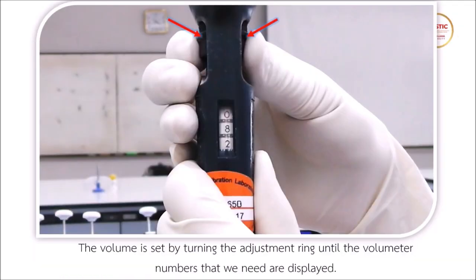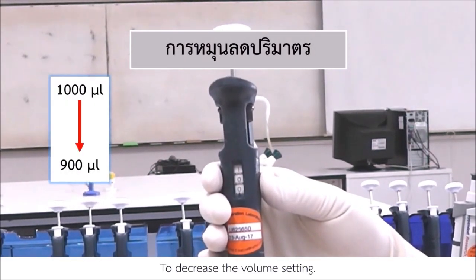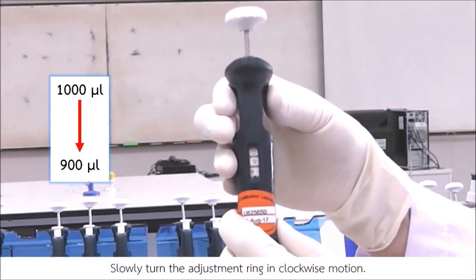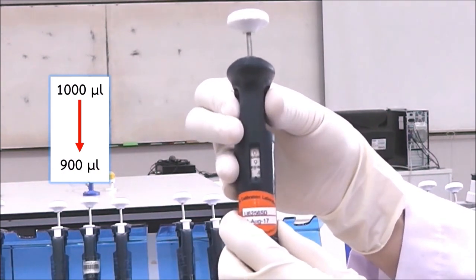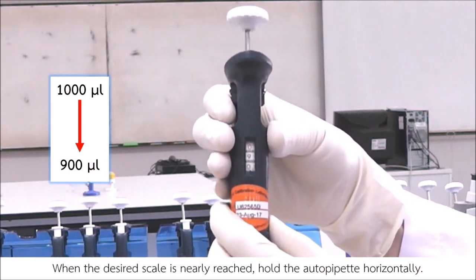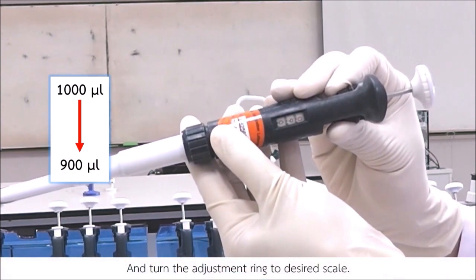Setting the volume. The volume is set by turning the adjustment ring until the volumeter numbers that we need are displayed. For maximum accuracy, the working scale should be set close to the arrow pointer. To decrease the volume setting, slowly turn the adjustment ring in clockwise motion. When the desired scale is nearly reached, hold the autopipette horizontally and turn the adjustment ring to desired scale.